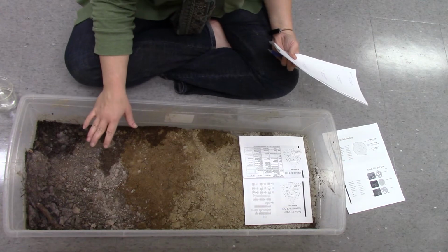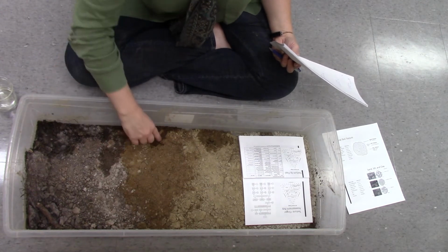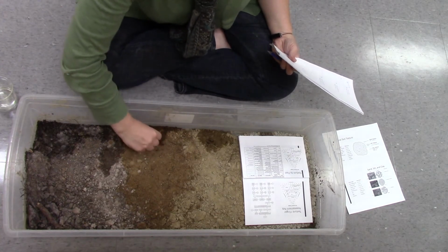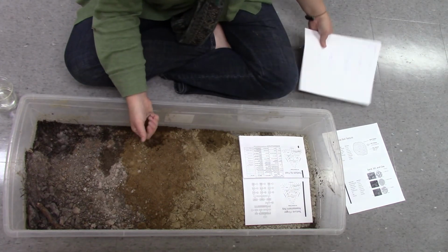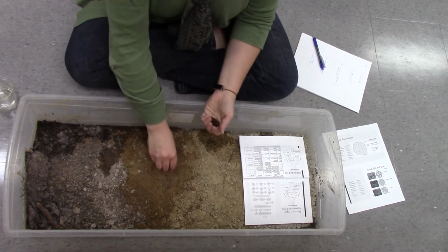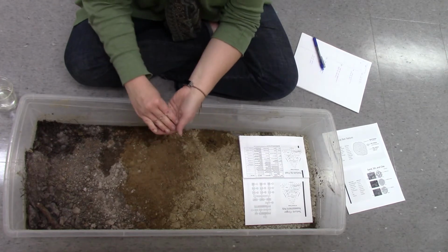These samples are all dry. You would usually have some wetter samples, so I've added a little bit of water to these to see if it'll be enough. The first thing you need to do is get it wet enough, because if I take this soil, it won't make a ball because it's too dry.